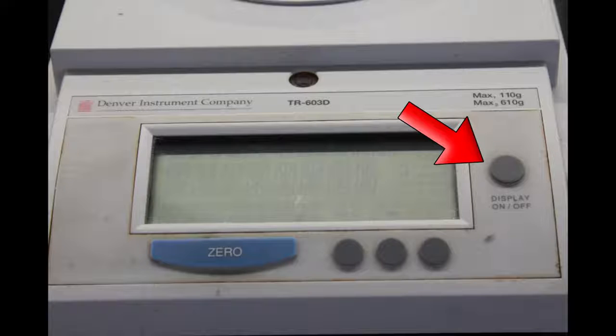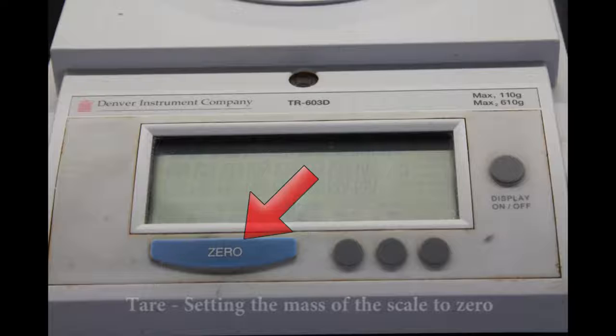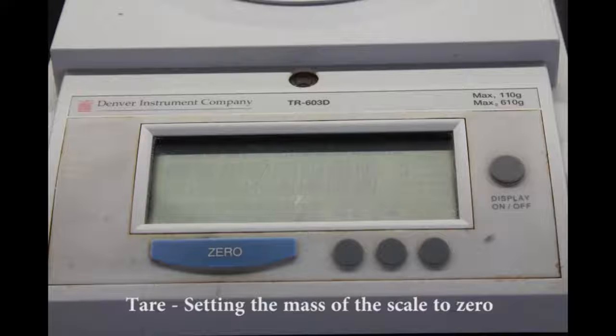After leveling your balance, it is ready for use. Here is the on-off switch, and here is the 0 button. It's also known as the tare button. To tare your balance means that you are going to set the displayed mass on the balance equal to 0. Now we are ready to weigh an object.